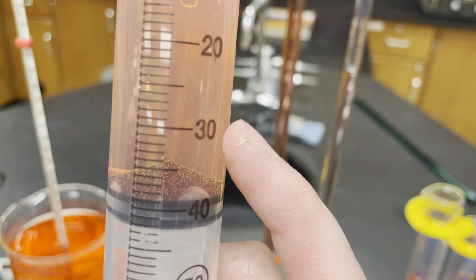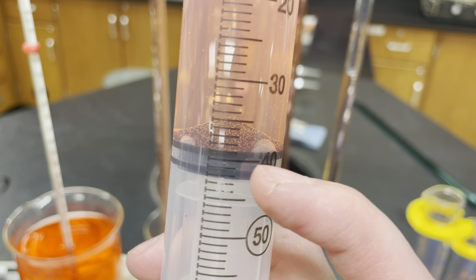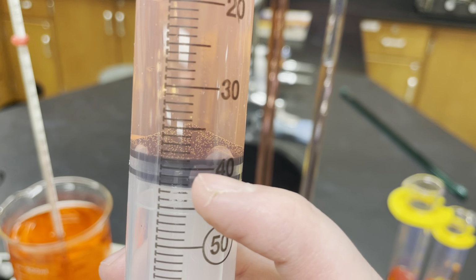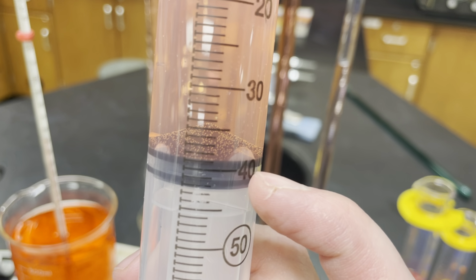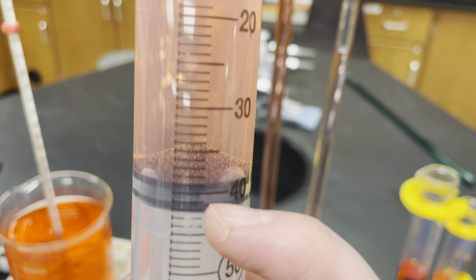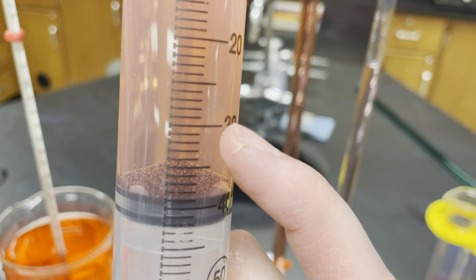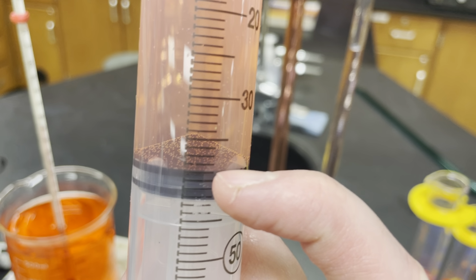Now you got to be careful because we're counting down in this case. Some people will see this 40 and they'll see this line here and say, ah, this is 41 milliliters. Not so, because up here is 30. This has to be somewhere in between 30 and 40. So if we say this is 41, then we're going in the wrong direction. 41 would be right here underneath the 40. So since we're counting downwards in this direction, be careful. This is going to be 30, 35, 36, 37, 38, 39.